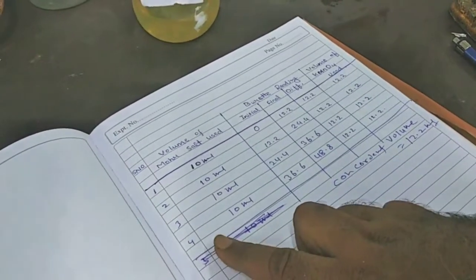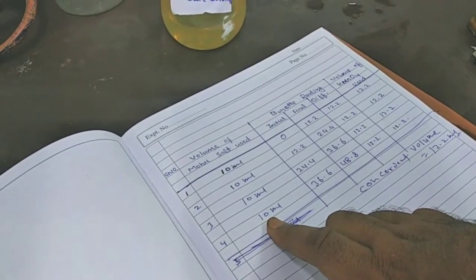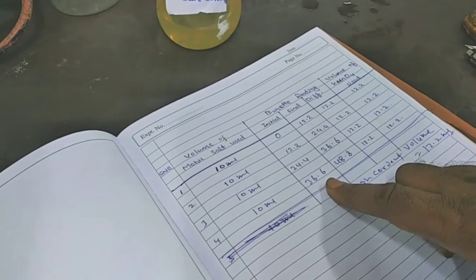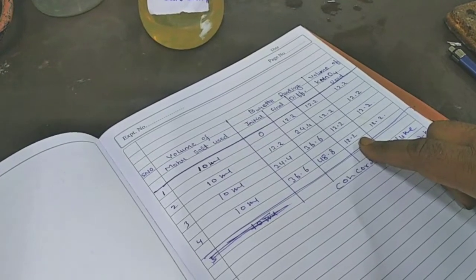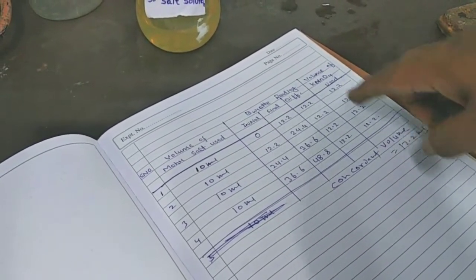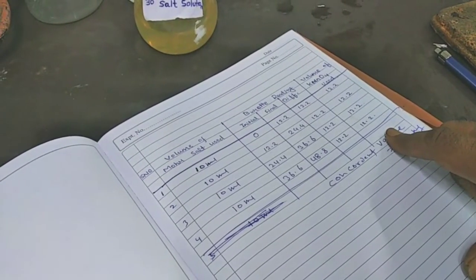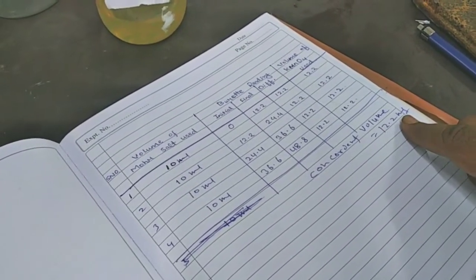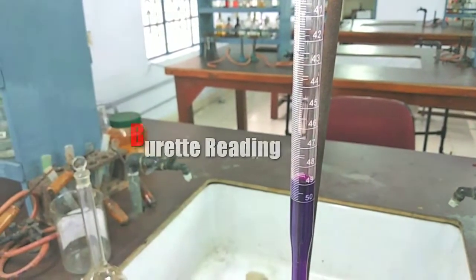For the fourth observation, volume of Mohr salt used is 10 ml, initial is 36.6, final is 48.8, and difference is 12.2, and KMnO4 used is 12.2. Means that the 4 observations observed during the experiment, that is 12.2, are all similar, so the concordant volume is 12.2 ml. Now coming to the calculation.